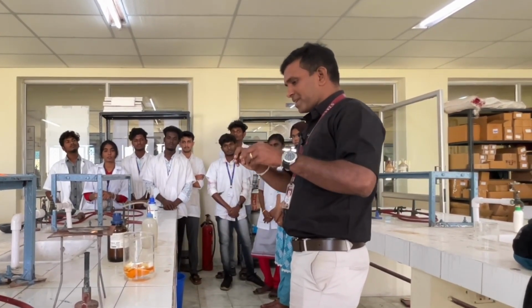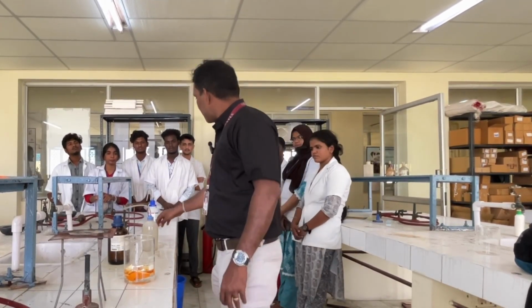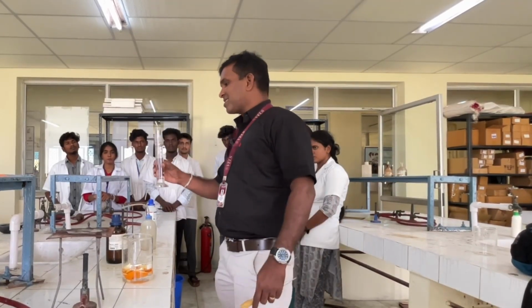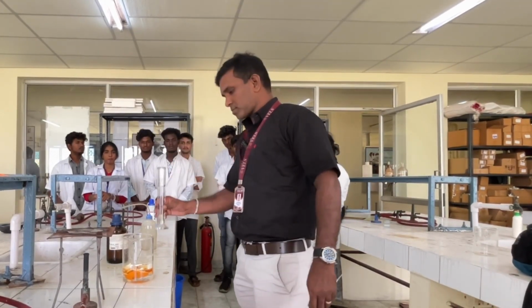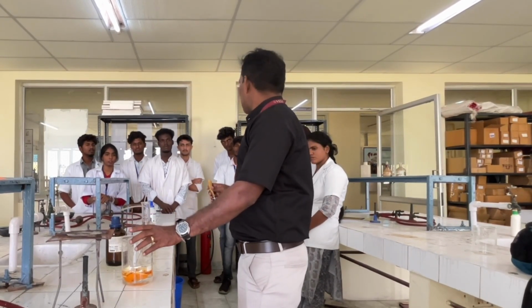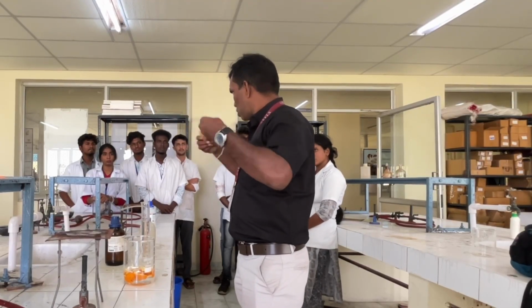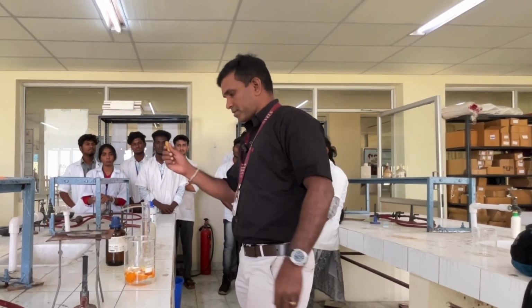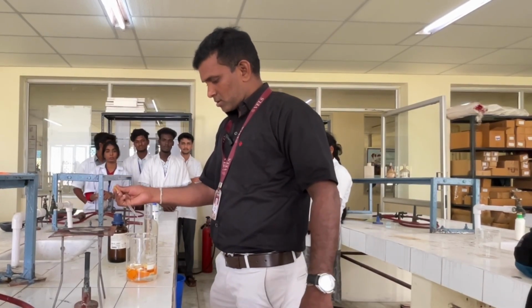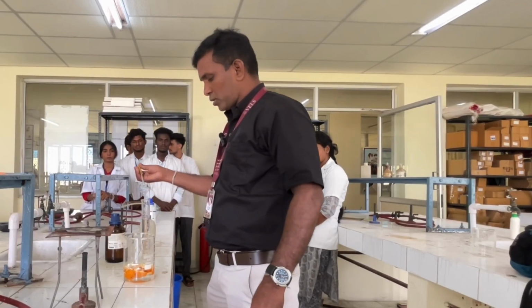You have to make that layer softer. This is a 3N hydrochloric acid solution. I am going to acidify this solution, which will increase the softening process. Add this hydrochloric acid dropwise.